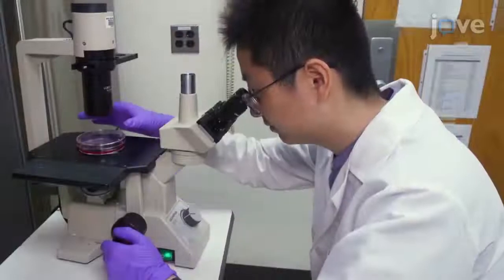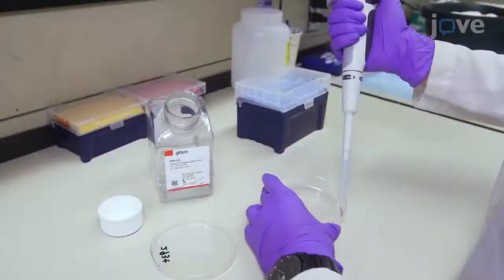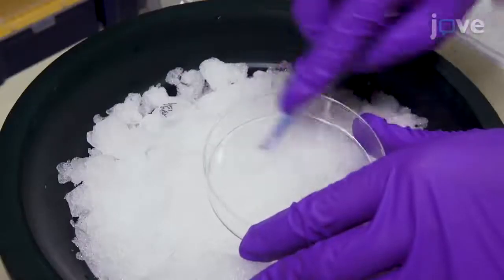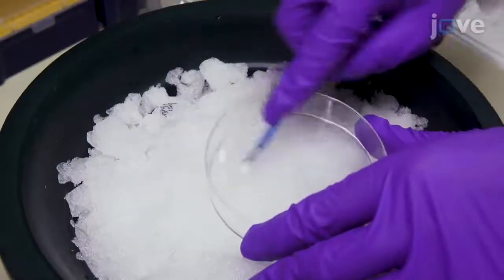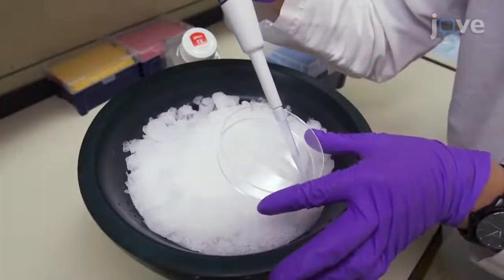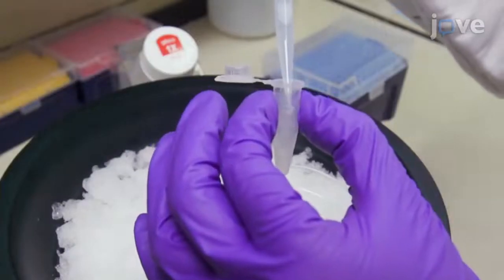When the culture reaches 80-90% confluence, wash the cells twice with cold PBS. Use a cell scraper to collect the cells into an appropriate amount of cold cell lysis buffer and transfer the lysing cells into a 1.5-milliliter tube.